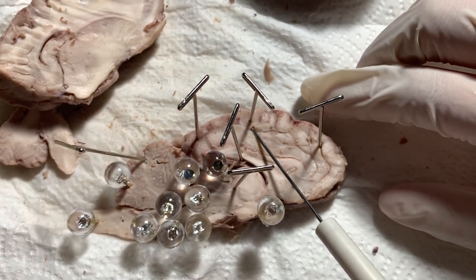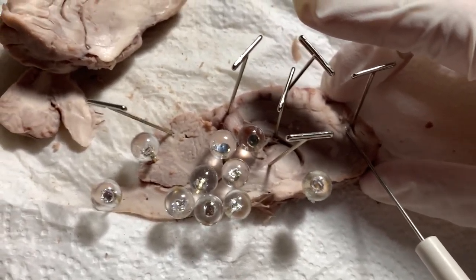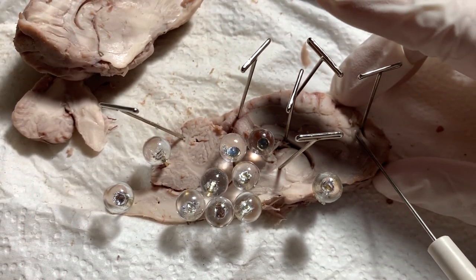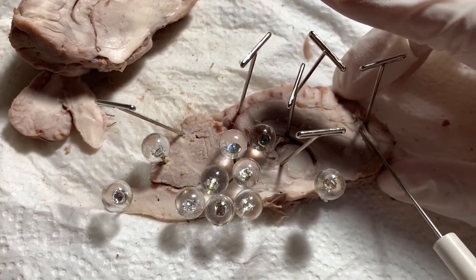Next we have the frontal lobe. The frontal lobe's objective is to be in charge of controlling emotions, self-control, movement, language, and rational thought.